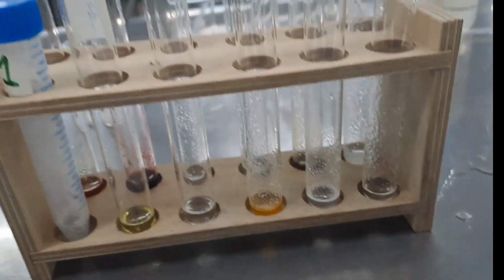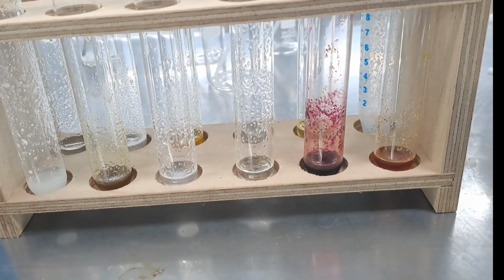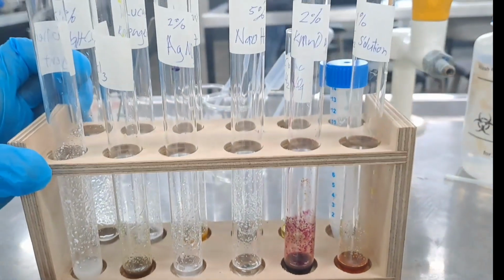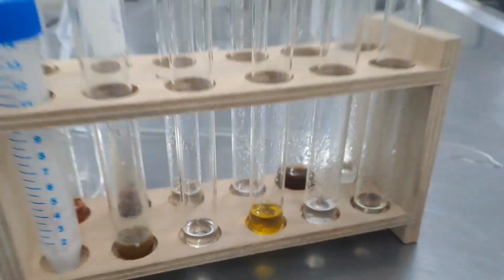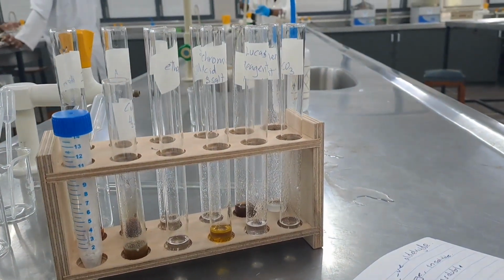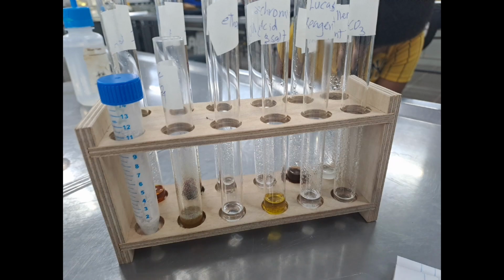After doing all the experiments, only one solution actually stood out, which is H2SO4 solution, and our unknown was added into the H2SO4 solution. As you can see, the color change here. It is the first test tube. Before distilled water was added, this is the color, and upon addition of distilled water, the color completely changed from light yellow to dark yellowish brown. It was concluded that our unknown was aspirin.